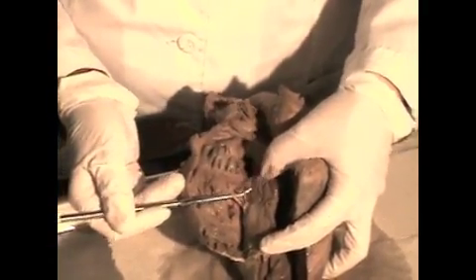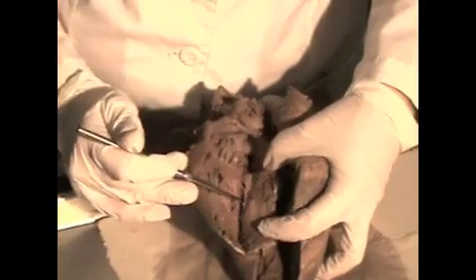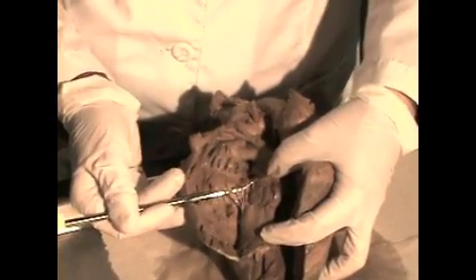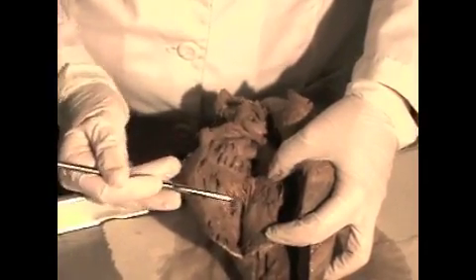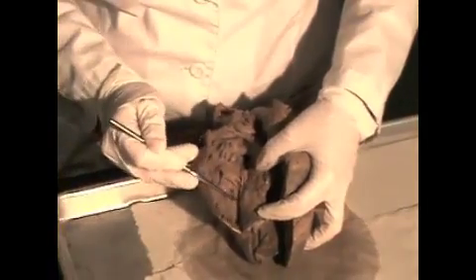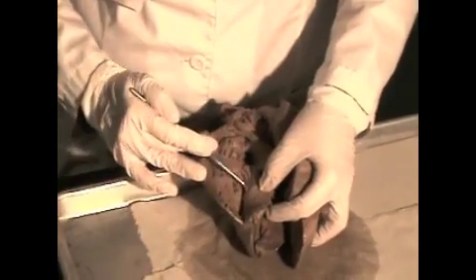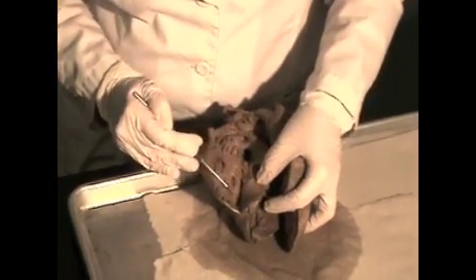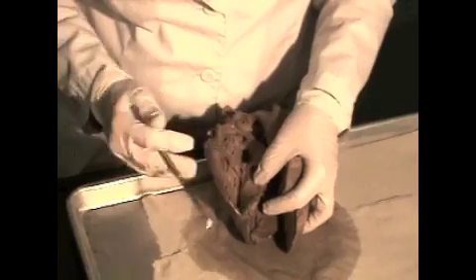These cords, and if you've ever heard that you have heartstrings, it's true, these are your heartstrings, but they are called chordae tendineae, tendinous cords of the heart. They are attached above to the valve itself, to the AV valve, and below they are attached to a muscular portion of the ventricle called papillary muscle. So papillary muscles attach to the cords, and they play a role in causing these valves to close.